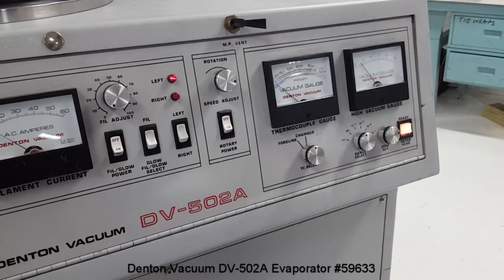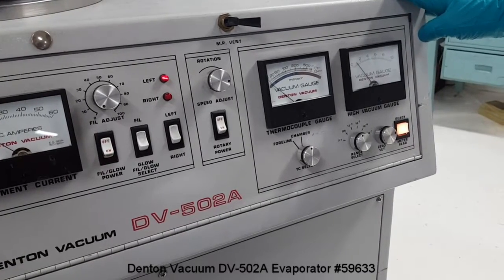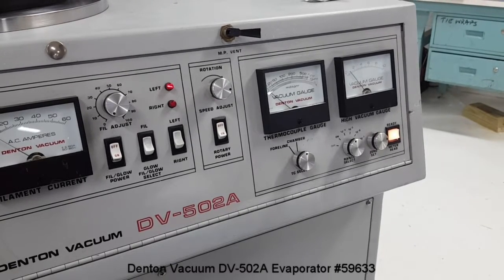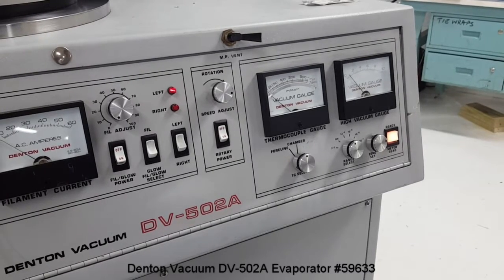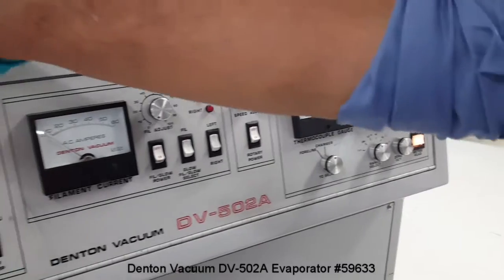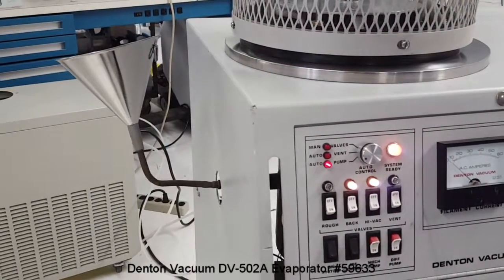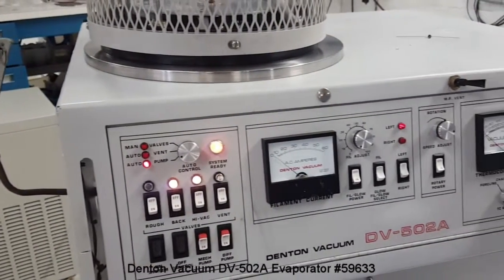Usually a system requires about 10 to 20 minutes when continuously operational. But when it is turned on for the first time, the diffusion pump should be allowed to warm up for about an hour or so. The diffusion pump requires 70 degrees Fahrenheit water circulation. There is a funnel on the left-hand side of the system where liquid nitrogen can be poured — only when the high-vacuum valve is open and we are already in the mid-10 to the minus 6 Torr range vacuum level.